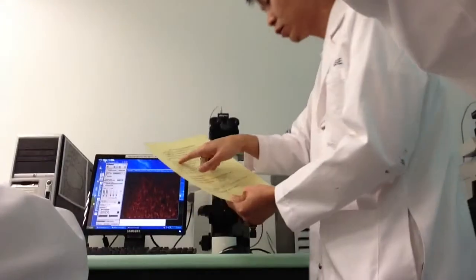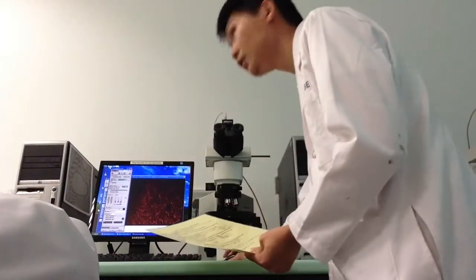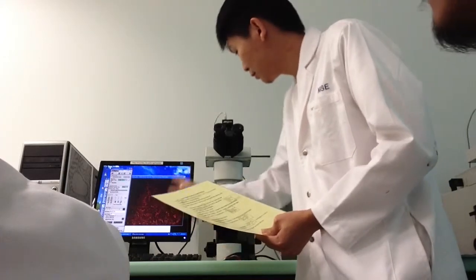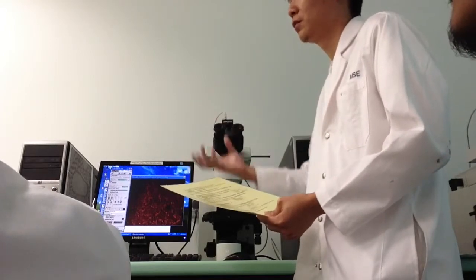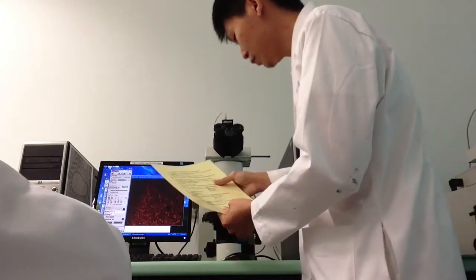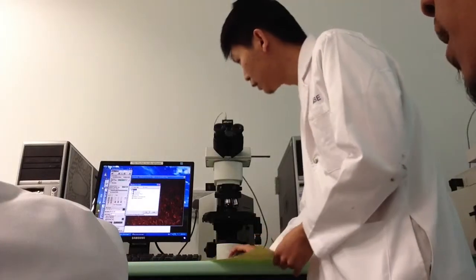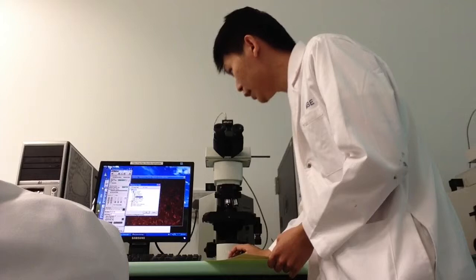So you proceed to step 6. My friend got a question. This part maybe, because sometimes when we are handling there's some dust or something. So step 6, you have to select your file path first. You choose My Computer, D drive.